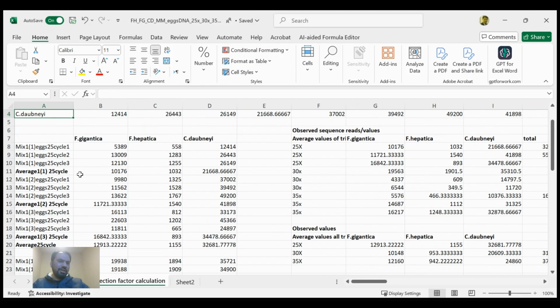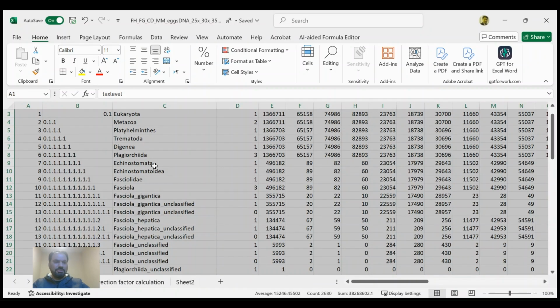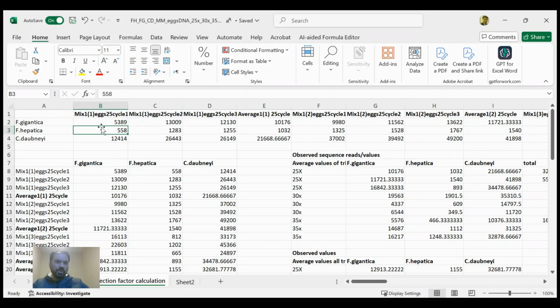I did it earlier, and then I did some manipulation. I selected only the required species: I am working on Fasciola gigantica, hepatica, and Calicophoron daubneyi, and the rest of the species are removed. I only kept these three rows, which indicate the three species I am working on. In the first row, you can see the different numbers of cycles that I have performed, in the form of different samples.